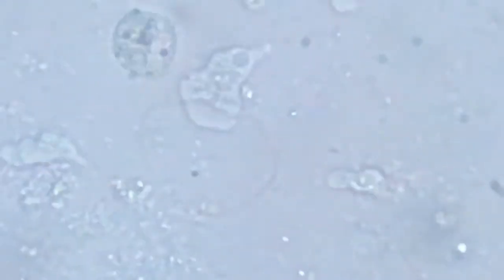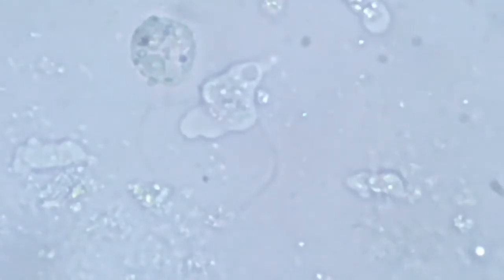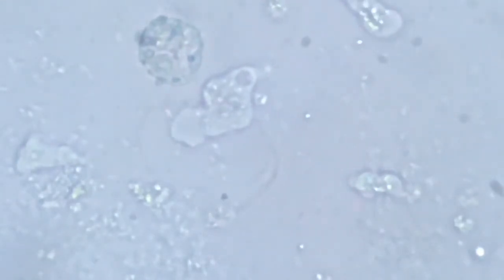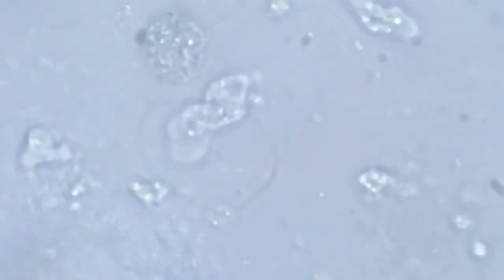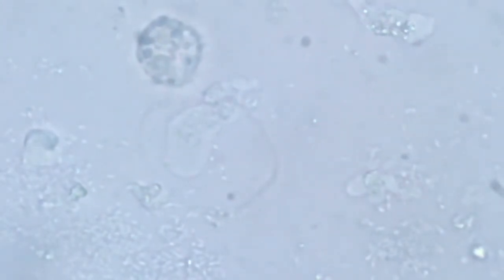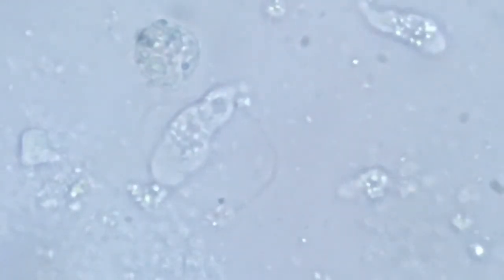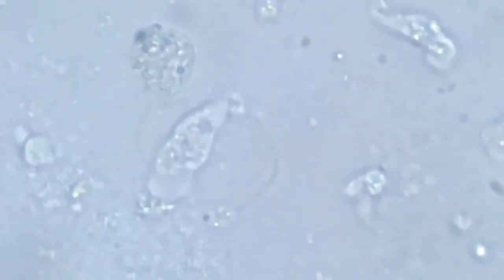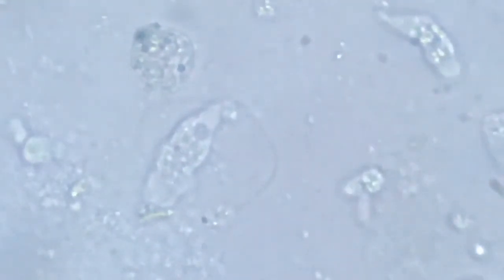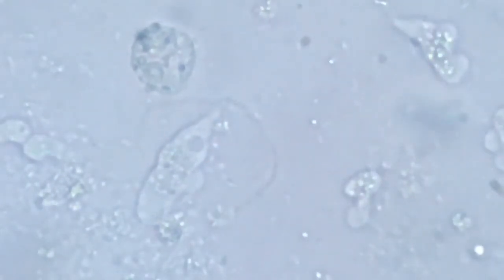This one is fascinating, big in size and moving gracefully. They're all very healthy and ought to be, because this water has a dead larva, and this water has a whole lot of organic matter to be converted to energy. It's up to them how much they can grab.